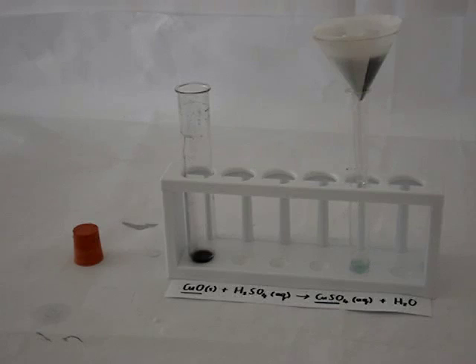Showing us that indeed, the metal oxide such as copper oxide reacts with an acid such as sulfuric acid to form a salt and water.